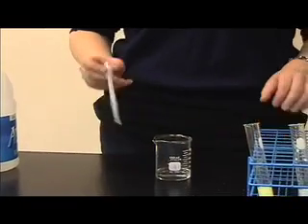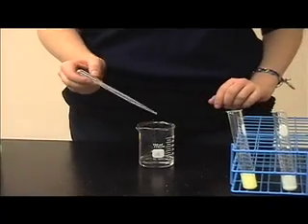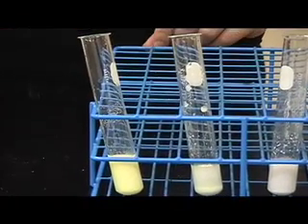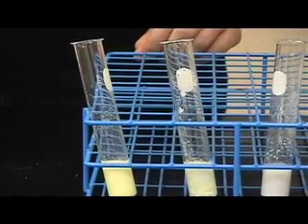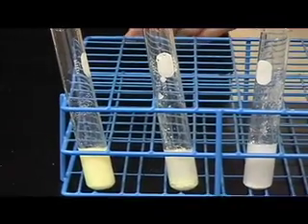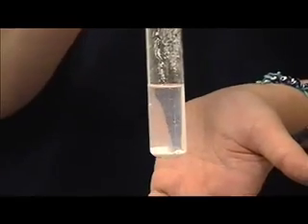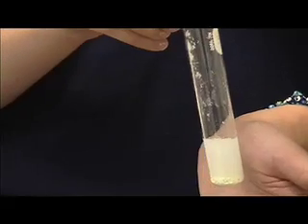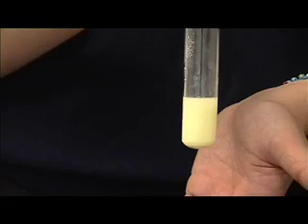Now I will be adding ammonia to the three halogens, and you'll see how ammonia helps chemists distinguish between the three. All three halogens go through double decomposition, a reaction between two compounds in which each compound breaks apart to combine with another part of the compound. Here is chloride, which dissolves with ammonia, bromide, which partially dissolves with ammonia, and iodide, which does not dissolve with ammonia.